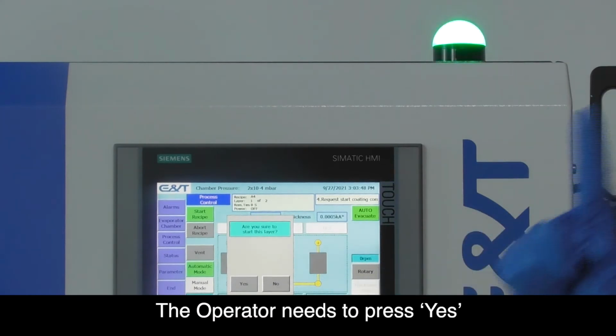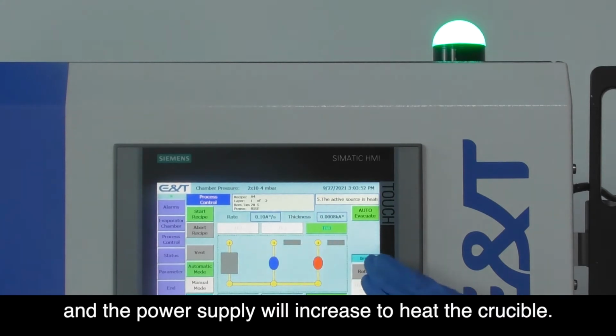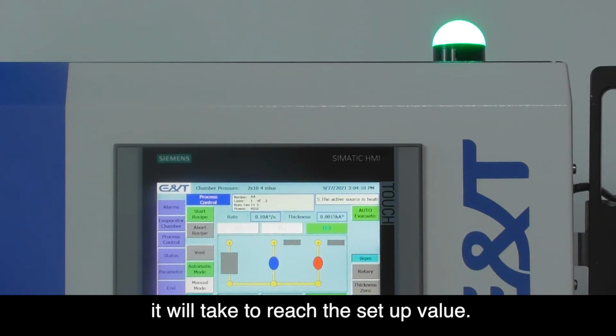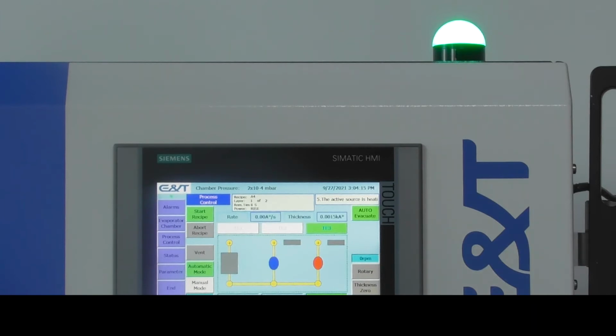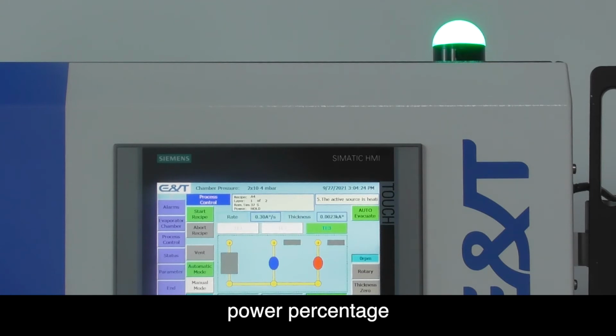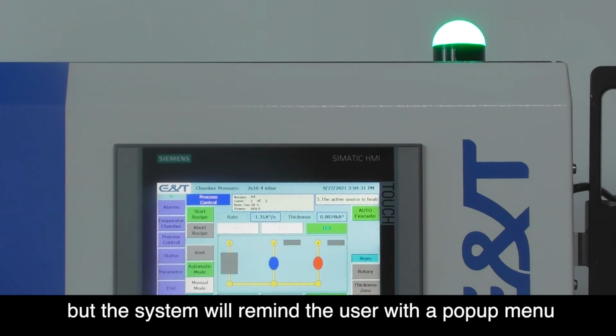The operator needs to press yes for the shutter to open automatically, and the power supply will increase to heat the crucible. From here, you can see the remaining time it will take to reach the setup value. There is a box showing ongoing information. Which recipe is on, how many layers there are, which layer is on. Ramp time shows how long it takes to reach the setup power percentage, helping the user to estimate the time and process. But the system will remind the user with a pop-up menu.